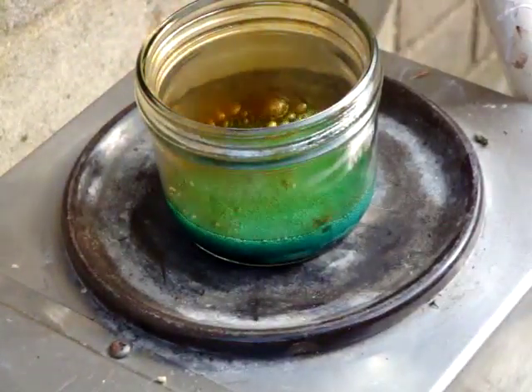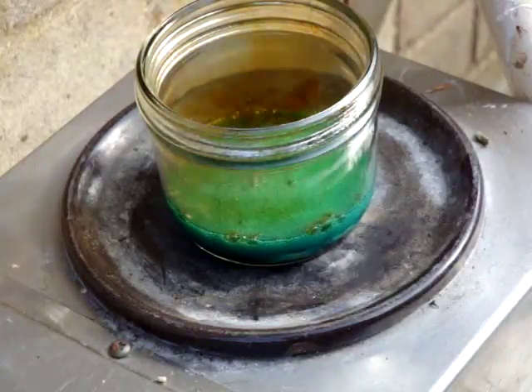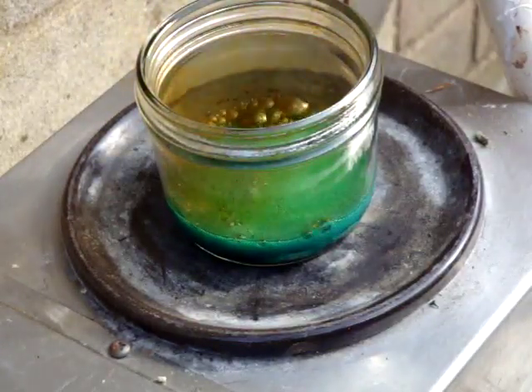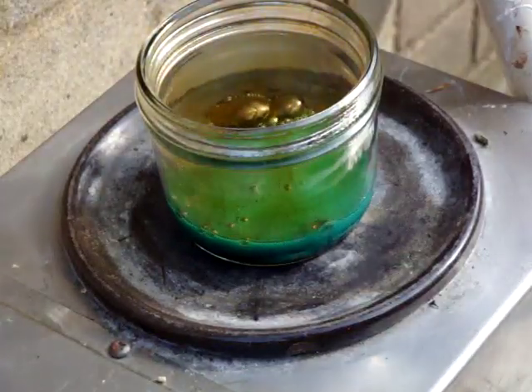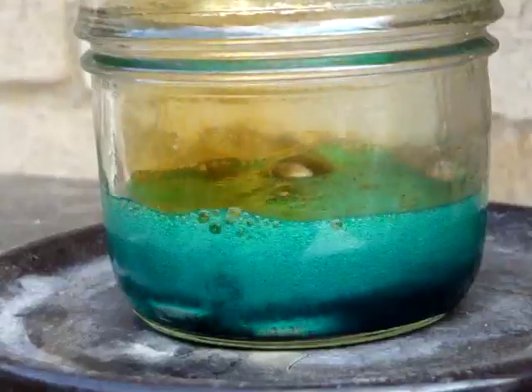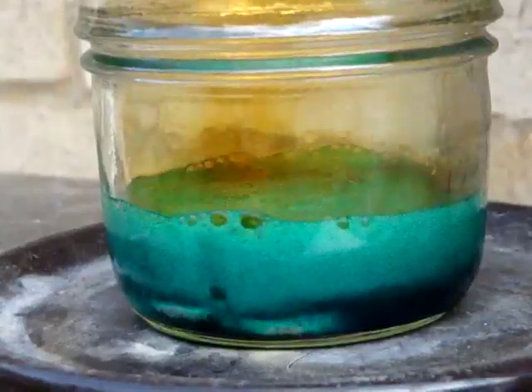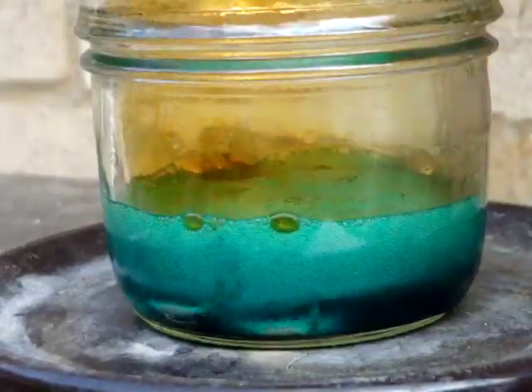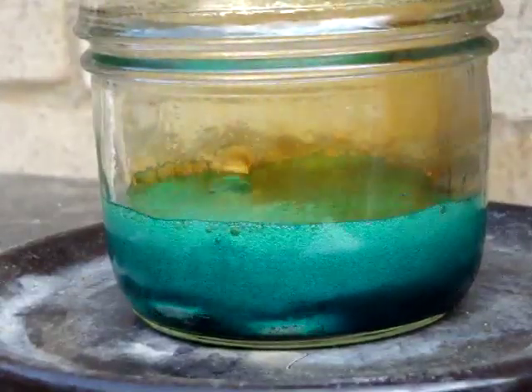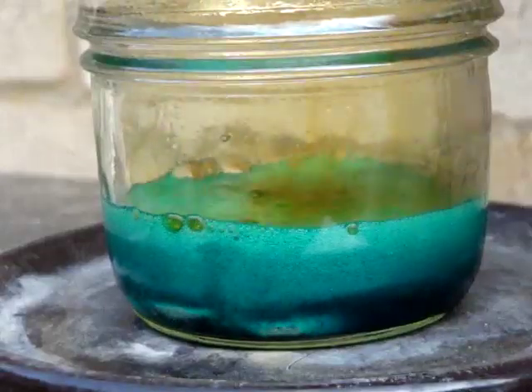Dangerous stuff - if you've got kids about, you know, dangerous. I'm not being held responsible for you burning yourself, your children, your pets. Dangerous stuff, be careful. I'm not being held accountable. Wow, look at this - look at it go. That's some very corrosive acid. It might even need some more acid in there, I don't know.